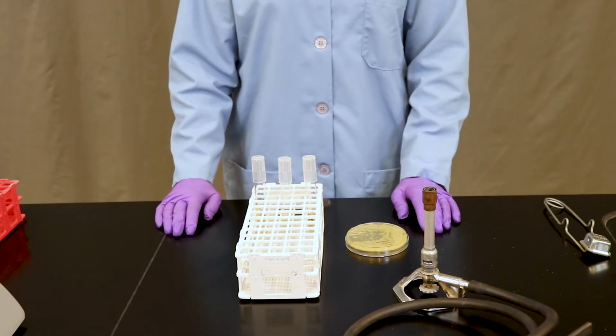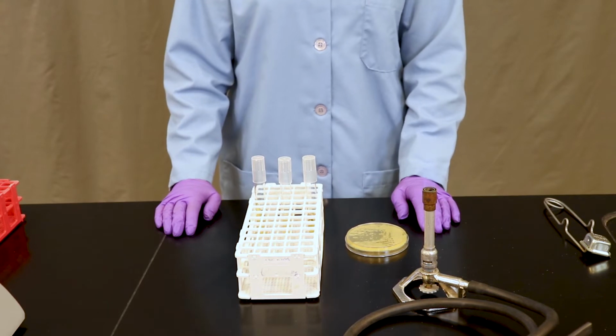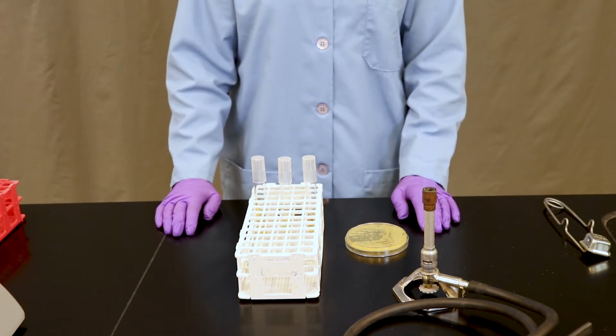Welcome to Bio 205 Microbiology at Pima Community College. In this video demo, we're going to introduce different types of test tube media and how they are aseptically inoculated.